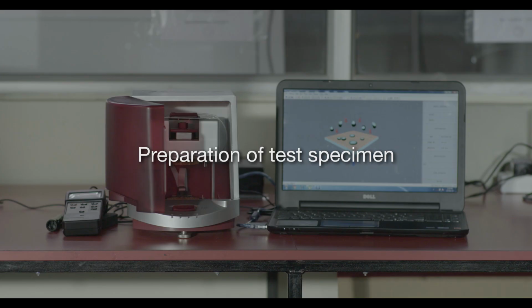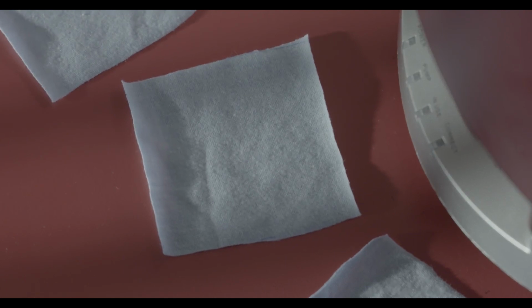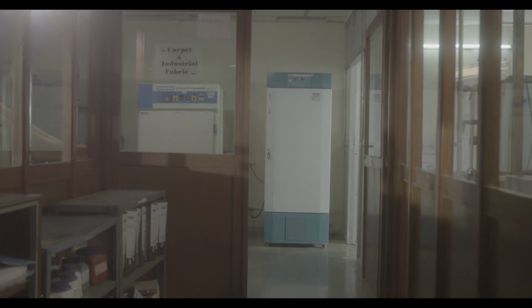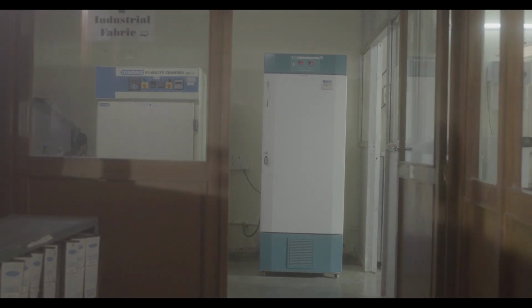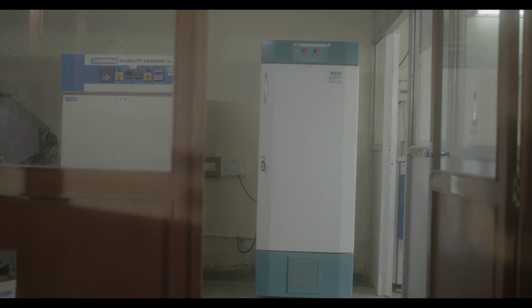Preparation of test specimen: cut 5 specimens, each of 8 by 8 centimeters, taken diagonally across the width of the sample. Condition them in an environment controlled at temperature 27 plus or minus 2 degrees centigrade and 65 plus or minus 2% relative humidity for 24 hours. Now the sample is ready for testing.